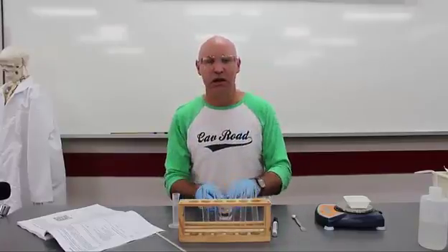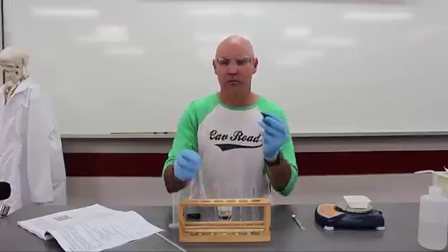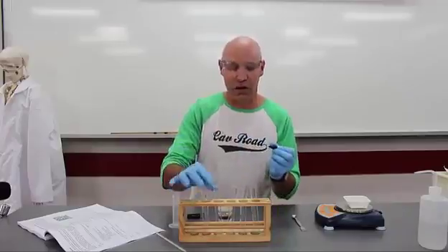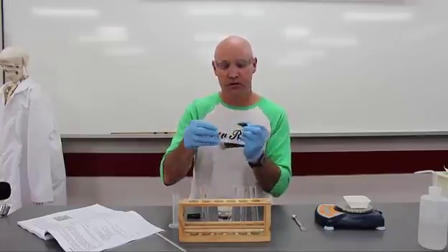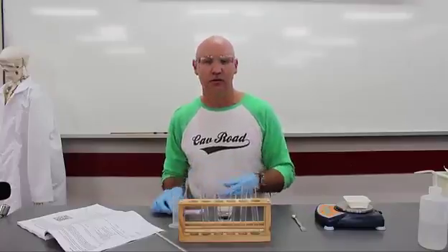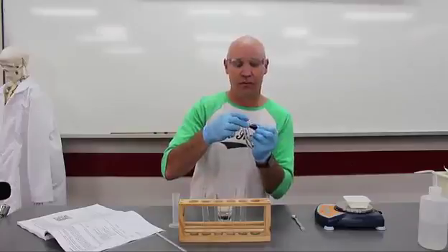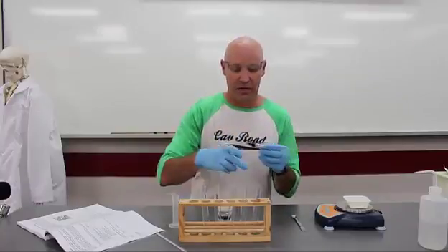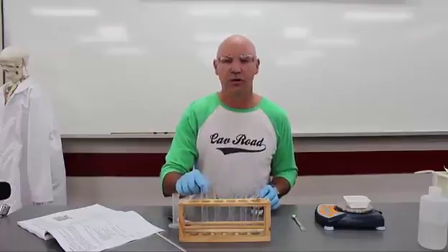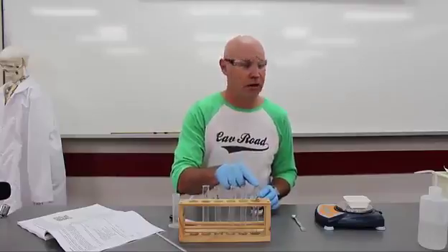Okay, so let me show you how we're going to do this experiment. We've got 5 test tubes. You need to use a permanent marker just to label them, 1 through to 5. I'm just going to do the first one for you today. In fact, I'm actually going to do the 5th one. And the 5th one is using 5 grams. So in the first test tube, we'll be using 1 gram of ammonium nitrate, 2, 3, 4 and 5 grams.